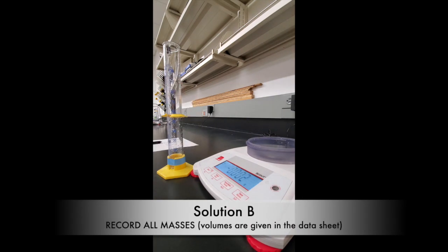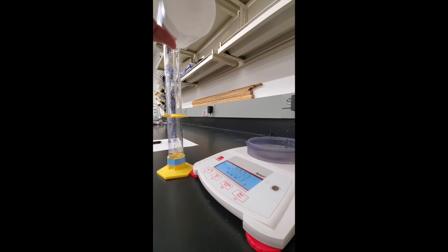We will repeat all of these same measurements for solution B. Please record the masses and the volumes for these will be provided for you.